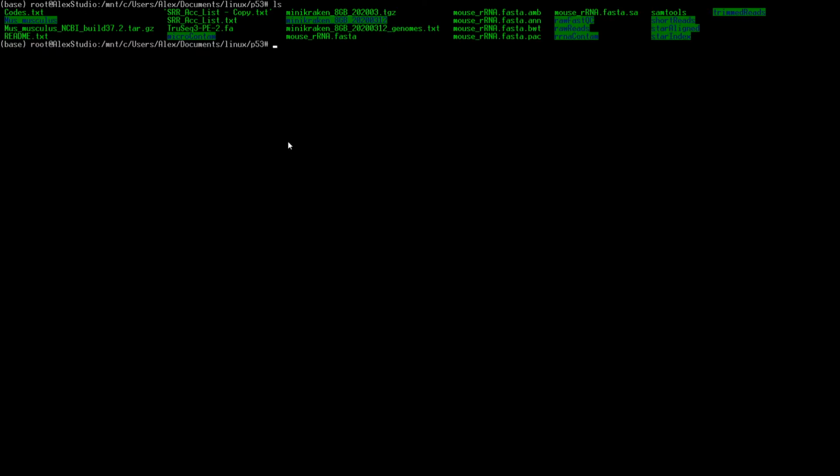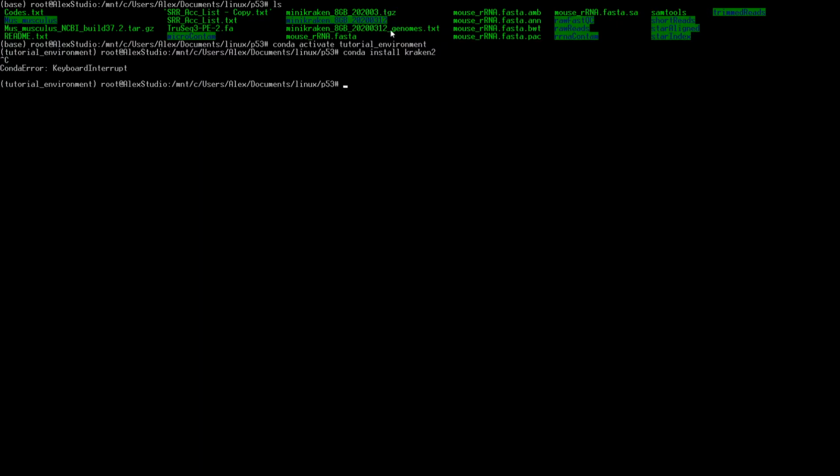well, let's get into our environment. So we'd have to do conda activate tutorial_environment. There we go. Now we're in our tutorial environment again, and we'll have to install conda install Kraken 2. So mine's already installed. It'll go through, start searching, but then it'll spit out requirements are already met. We'll cancel that. But so conda install Kraken 2 and then conda install BWA. And this is what we're going to use for the rRNA.